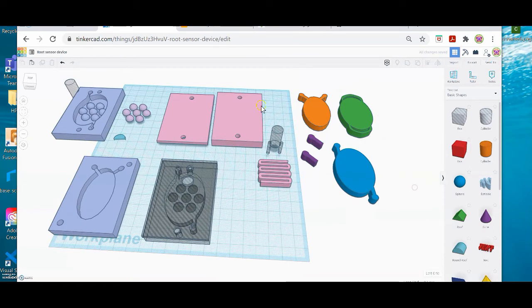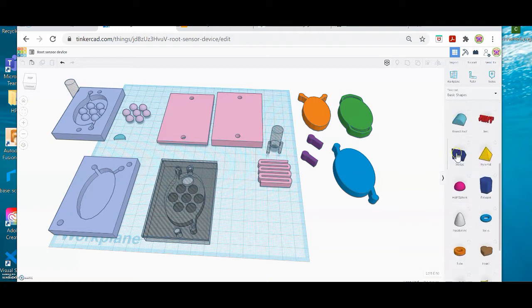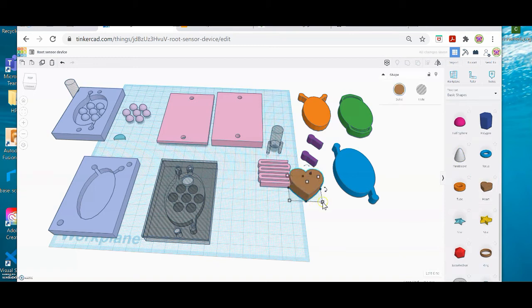So again, our first step is to make the hole shape on this, and you have a whole area on the right that's kind of an elevator shaft of forms, and I'm going to pick a heart. And I'm going to scale it up a little bit. If you hold the shift key and drag out a corner, you keep your design in proportion and scale. But if you just drag a little point at the bottom, you can distort it.